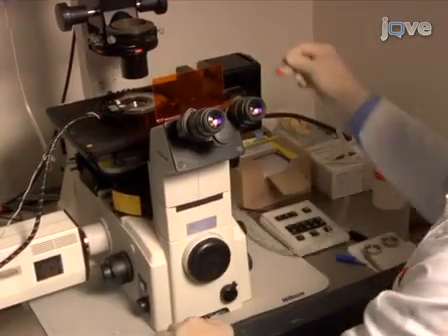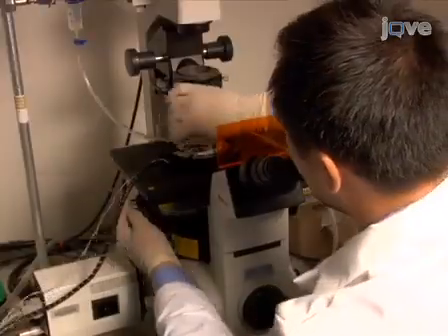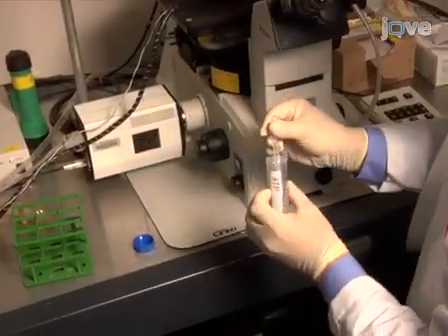Then apply the calcium mobilizing agonist via a perfusion apparatus, noting the addition time for each agonist. Exposure times and acquisition intervals should be optimized to prevent photobleaching while still allowing sufficient temporal resolution.